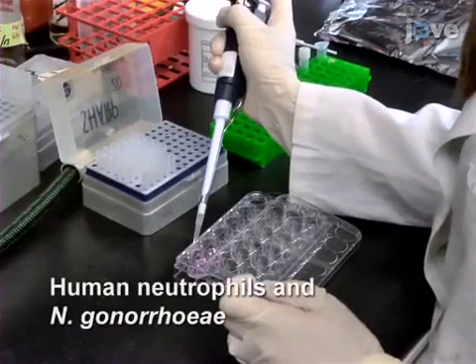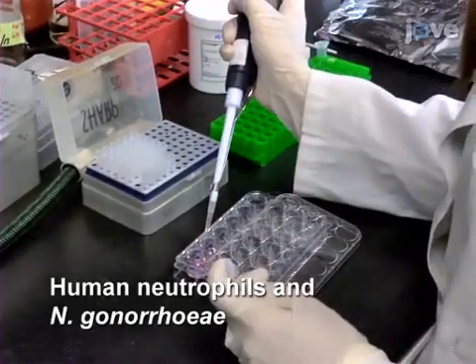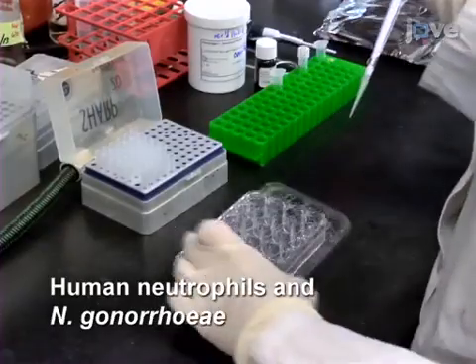To cells cultured on circular glass coverslips in 24-well plates, add bacteria of interest and incubate for the desired time.